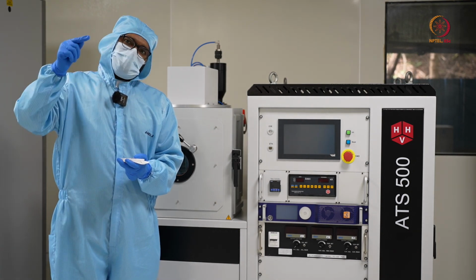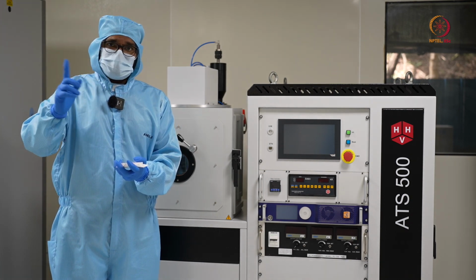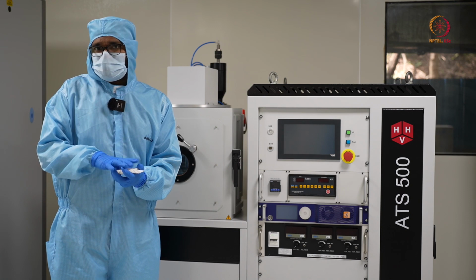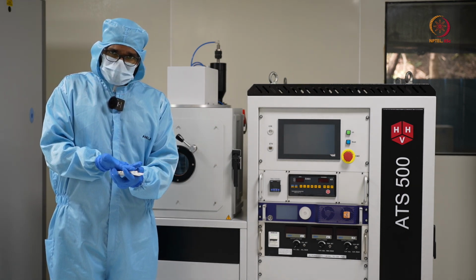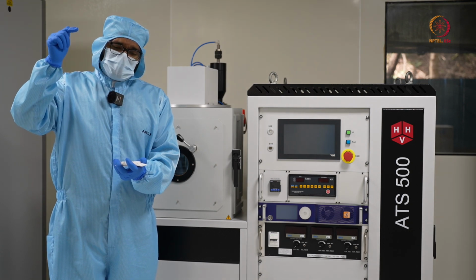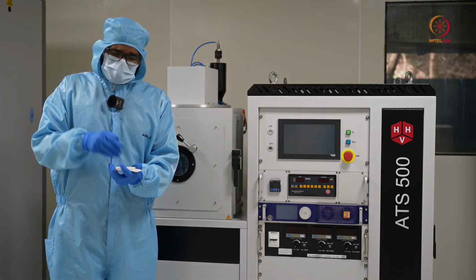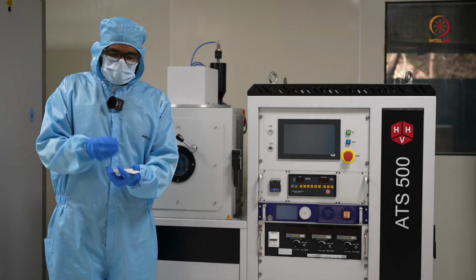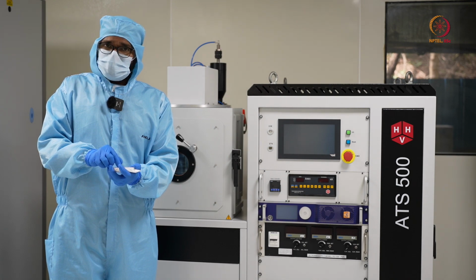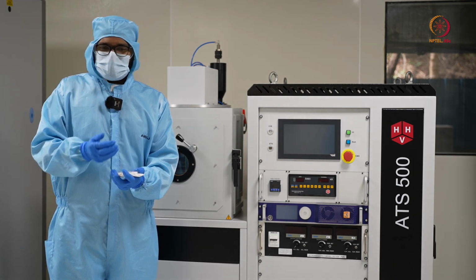The desired material that you want to coat will be placed on the negative electrode. So when the argon ions are rushing towards this source material, they will directly hit and impinge on the source material and dislodge some molecules of it.